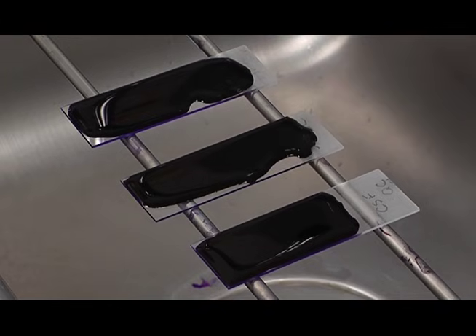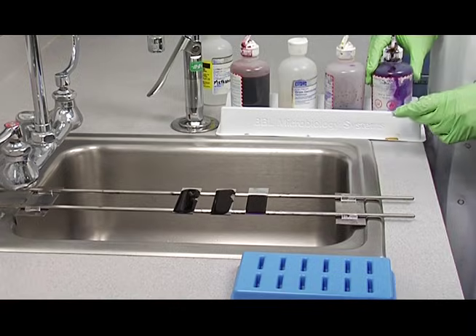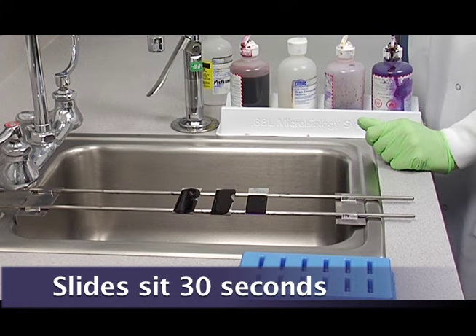That stays on there for 30 seconds, and I usually start timing after I've added to the last slide.